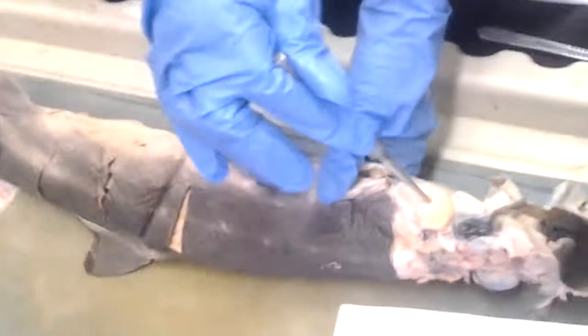We did cross sections of the muscles at the beginning. Is that going to be on it? Are we going to have to look at a cross section of the muscles? Like the one that's a circle, the mandibularis. Yeah.